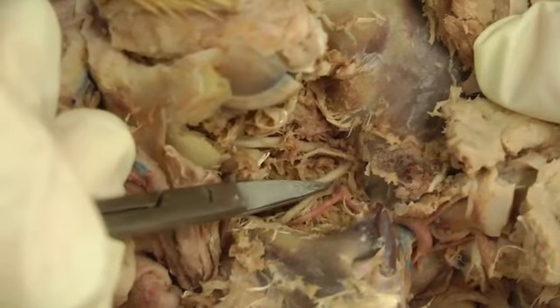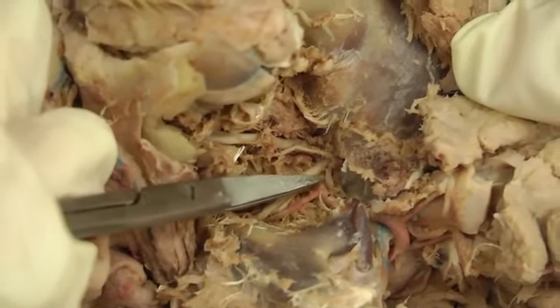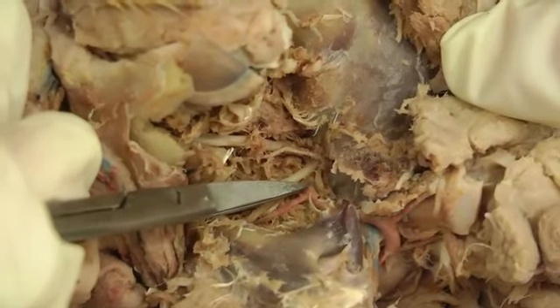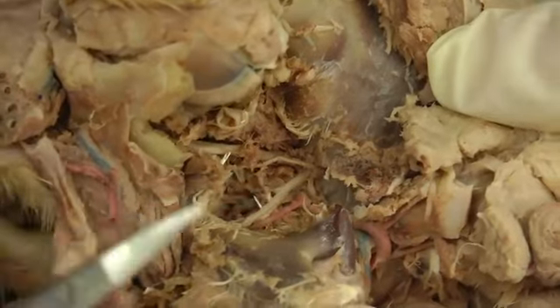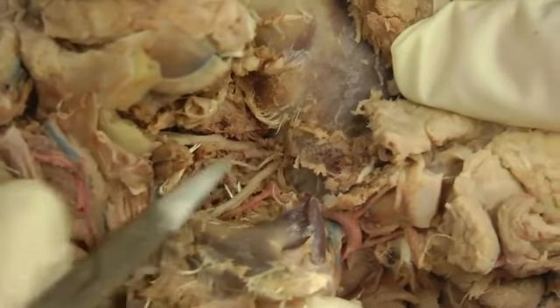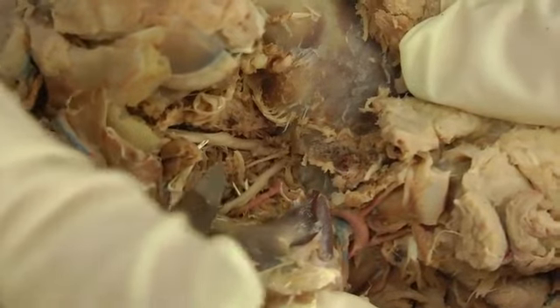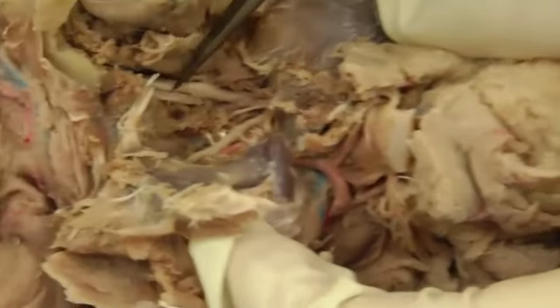And I do believe I broke my deep temporal, or caudal deep temporal. So it would have been right here going to the temporalis muscle. So then the rest of maxillary, unfortunately in this cat, lost its injection and was broken. So we have 2 strikes against us here. But we have this little bit, just right here would be maxillary coming along.